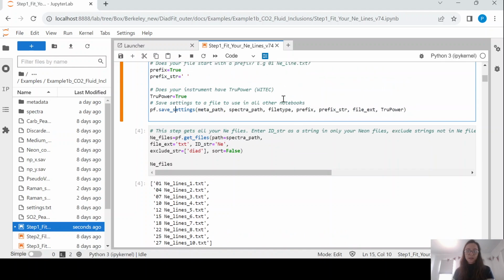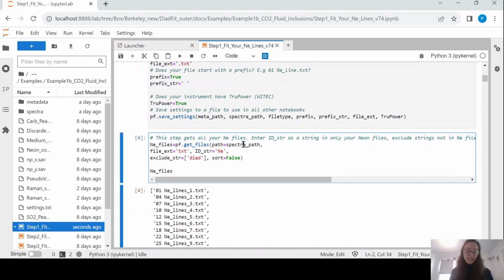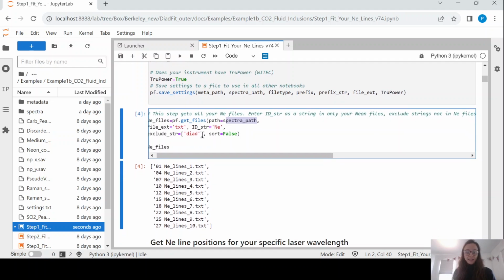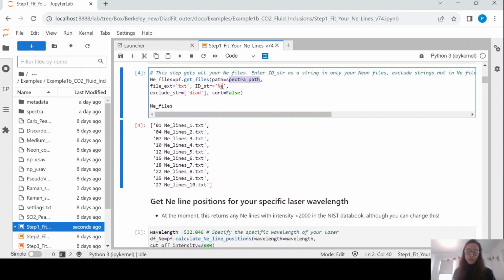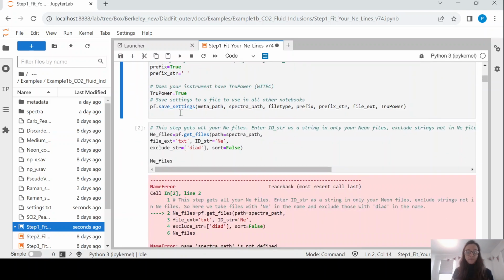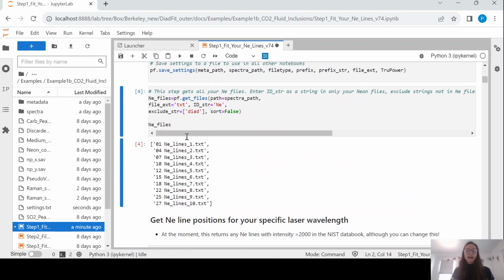Okay. So the first thing we're going to do is we're going to get all of the files which are acquisitions of neon. So the way you're doing this is you're telling it where your spectra is stored, and you are basically saying what string is in all of your neon files. In this case, we've used the letters NE. You might have used capital NE, you might have written out neon. Whatever you've done, it's just going to be looking for files which match that string.